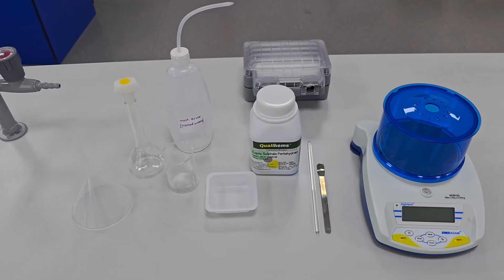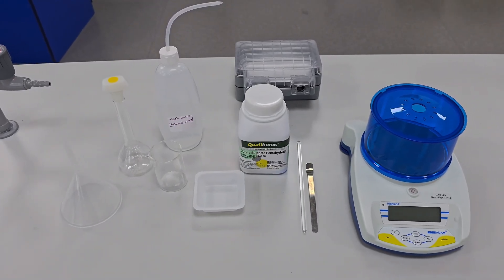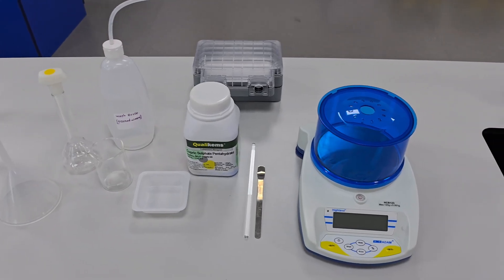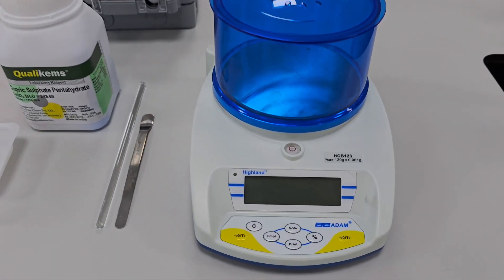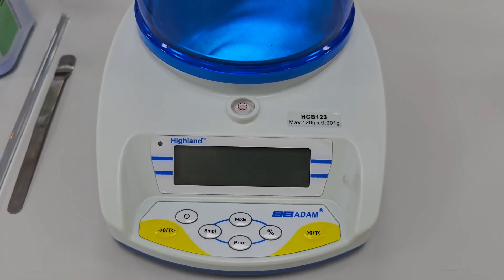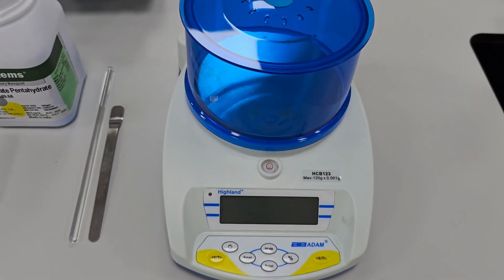Today we'll be preparing a standard solution of 0.1 mole per decimetre cubed of copper(II) sulfate using precise lab techniques. This video is perfect for IB chemistry students learning about standard solutions and molarity.